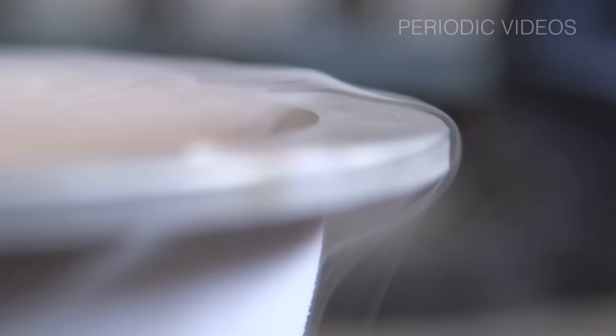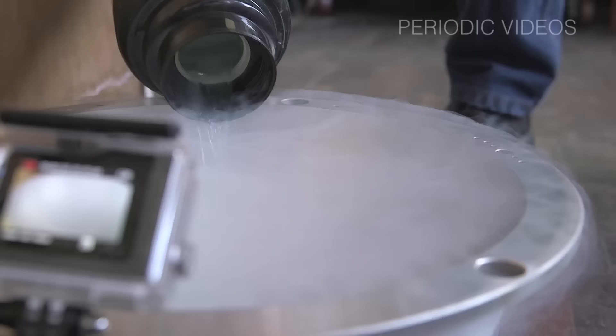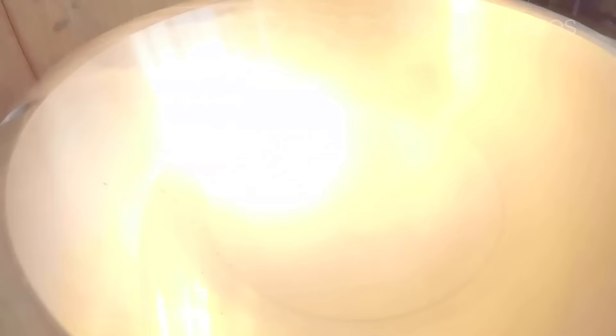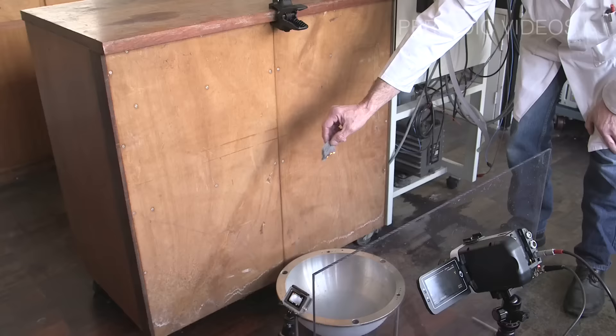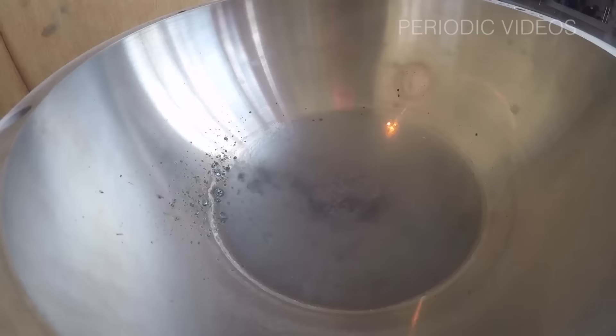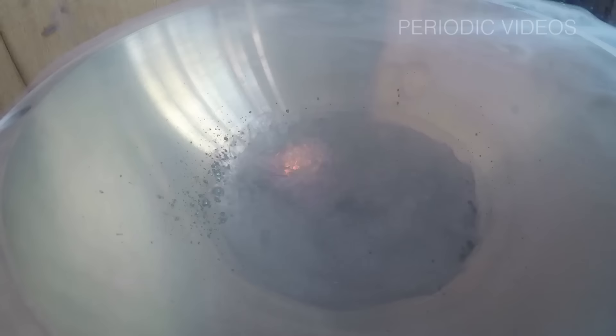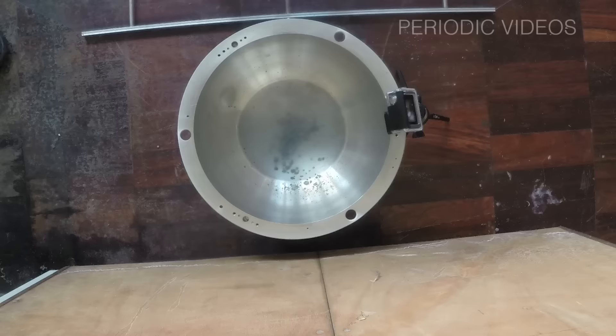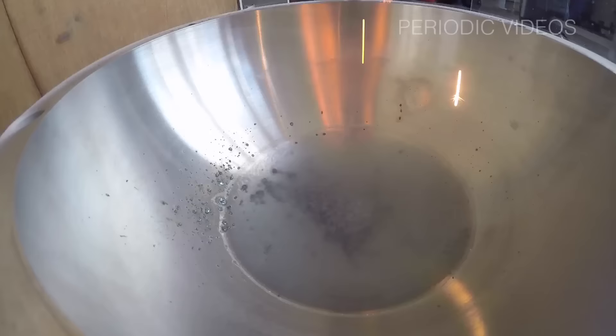And then they dropped it into Neil's favourite cauldron, in which he often puts liquid oxygen. When they dropped it in, and they did it several times, there were the most amazing colours.